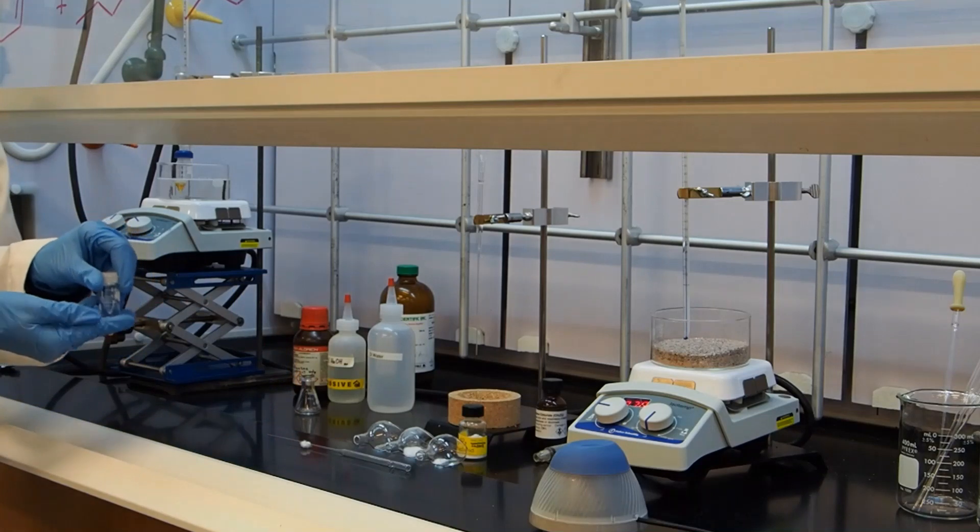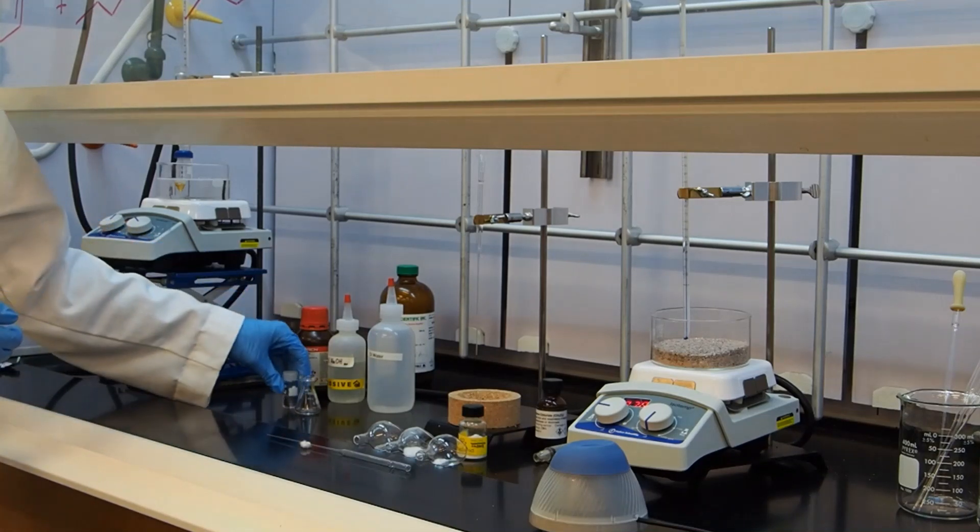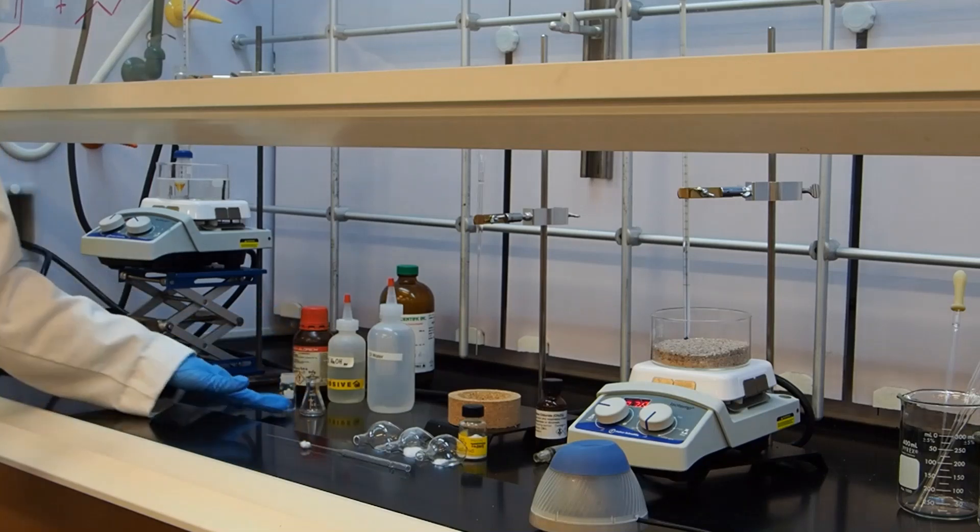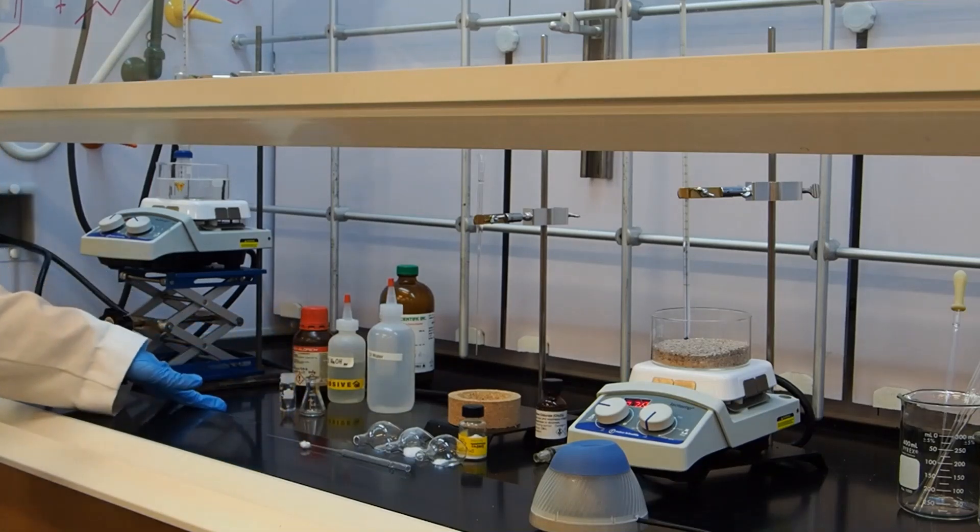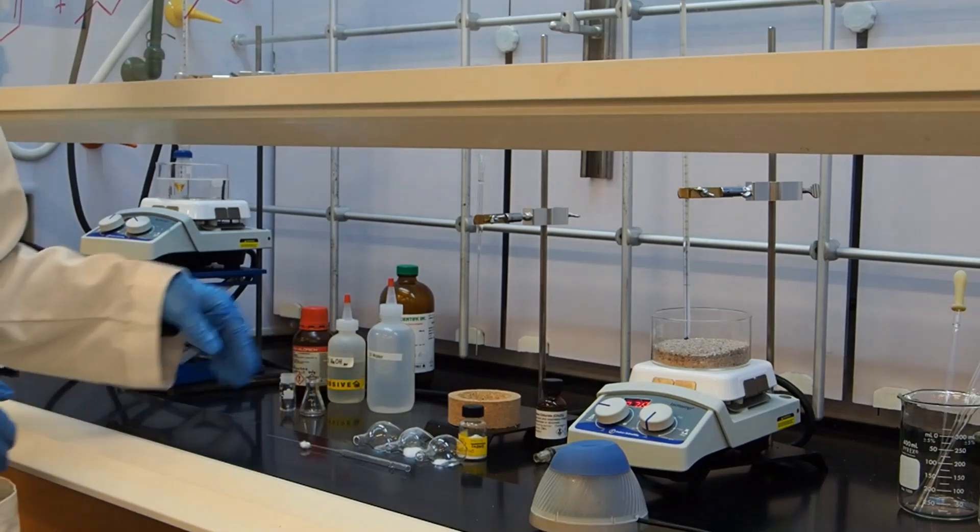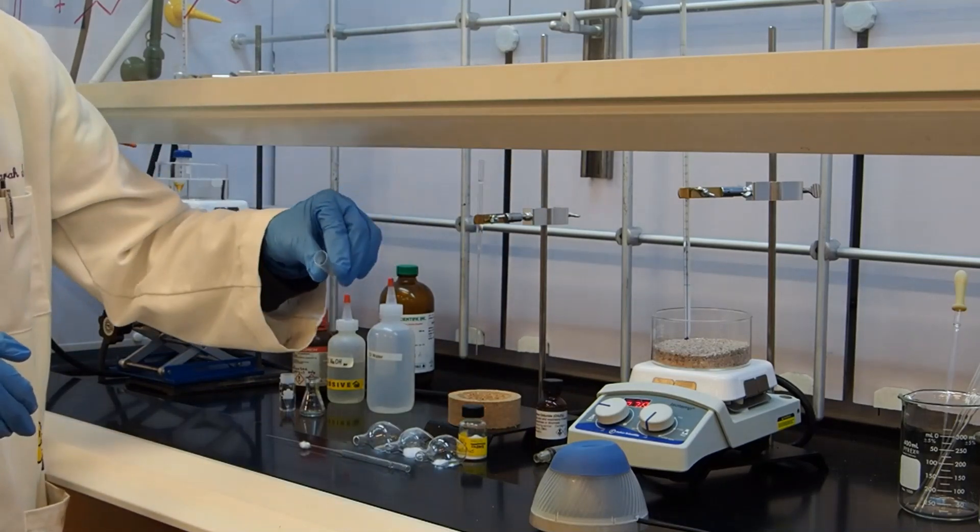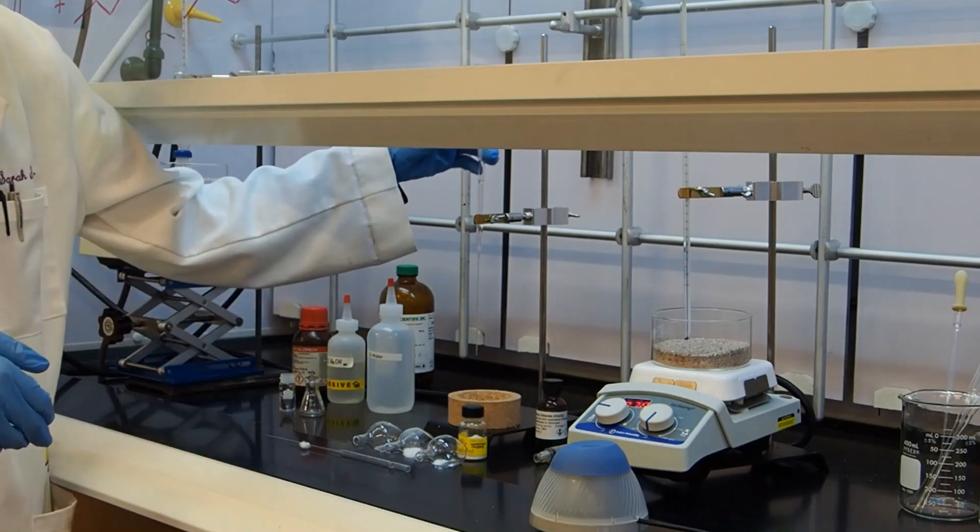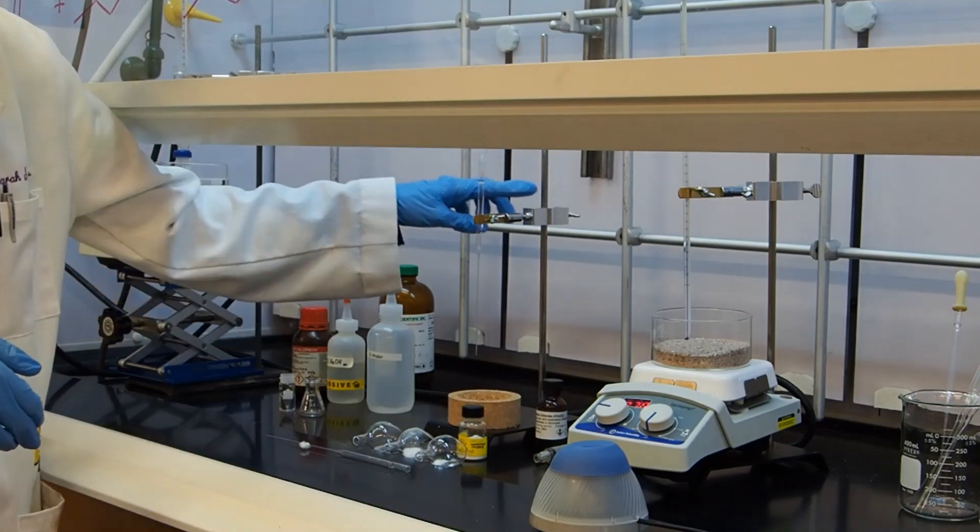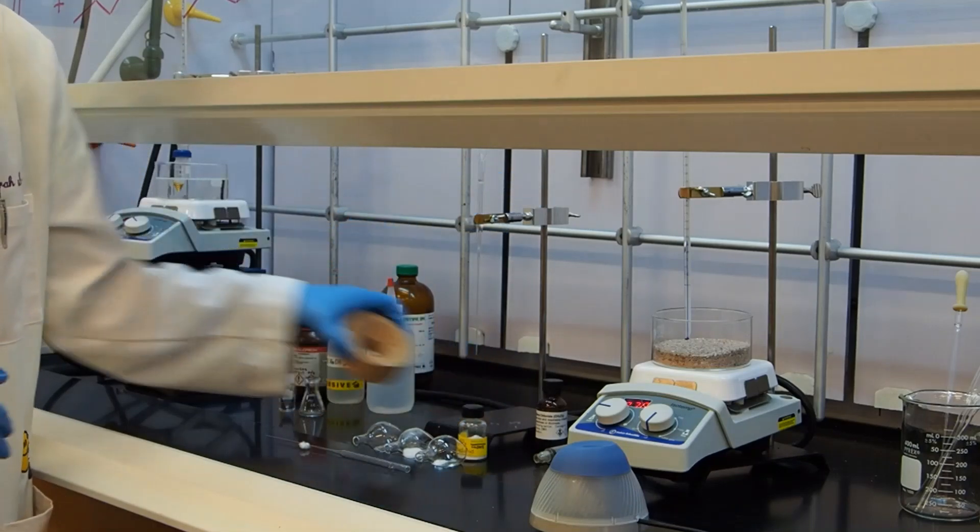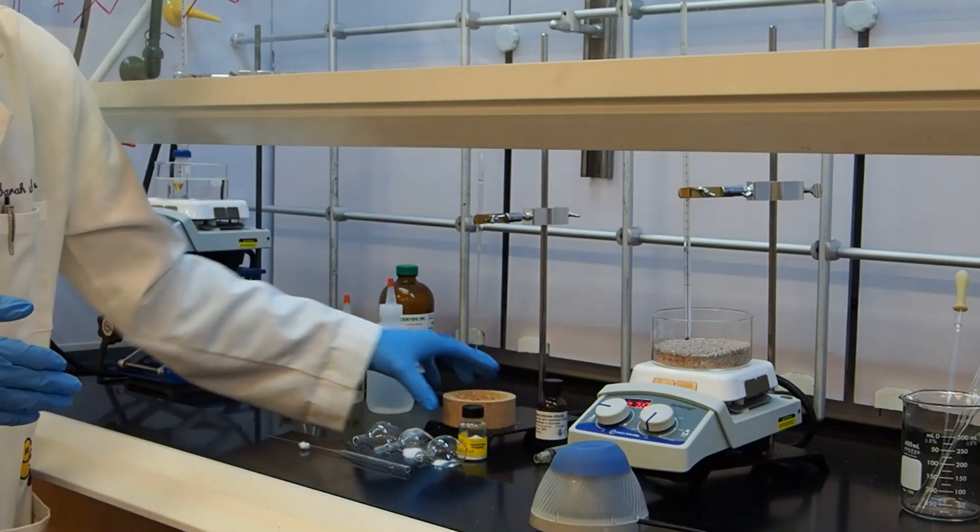I've gathered my 3 mL conical vial and my Erlenmeyer flask, which will be used to place the separated layers in. I've also prepared a pipette with a makeshift funnel made from a plastic pipette, equipped with a thermometer clamp and a ring, cork ring.